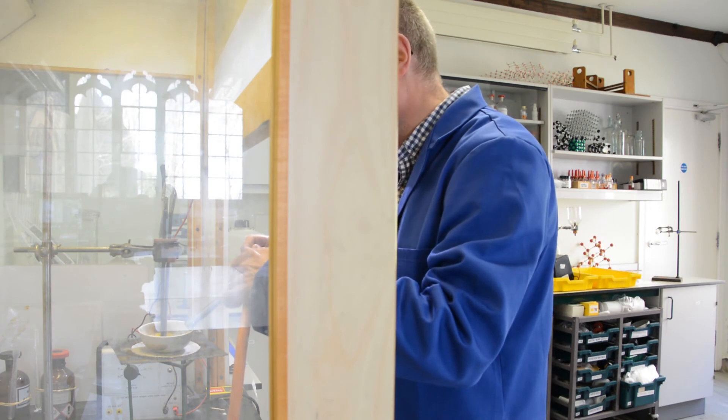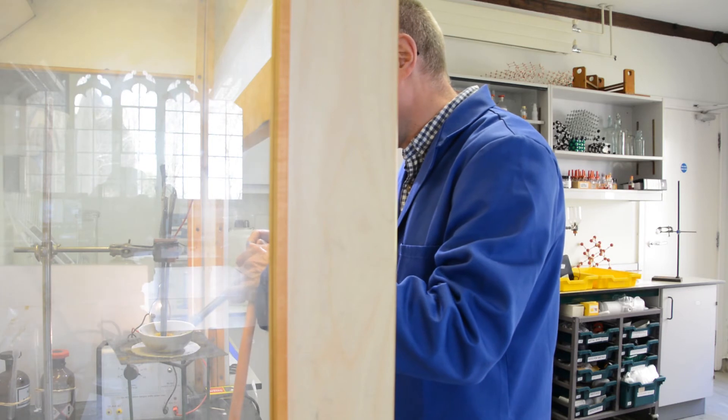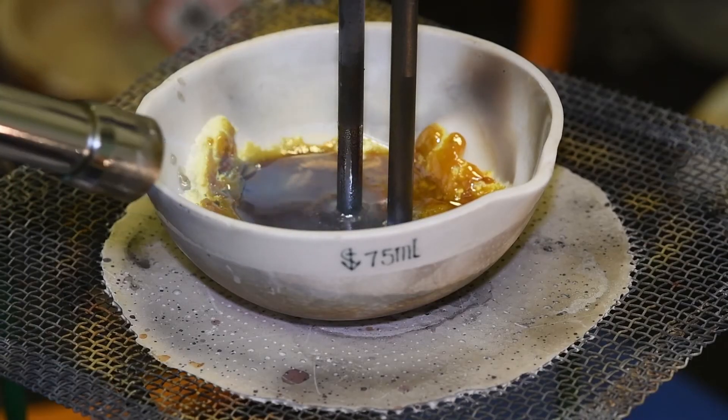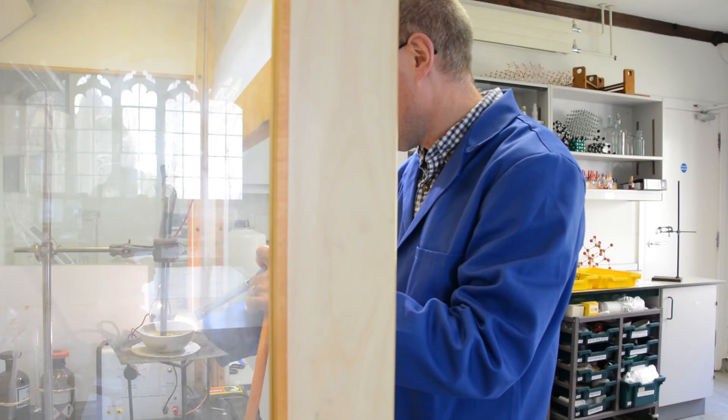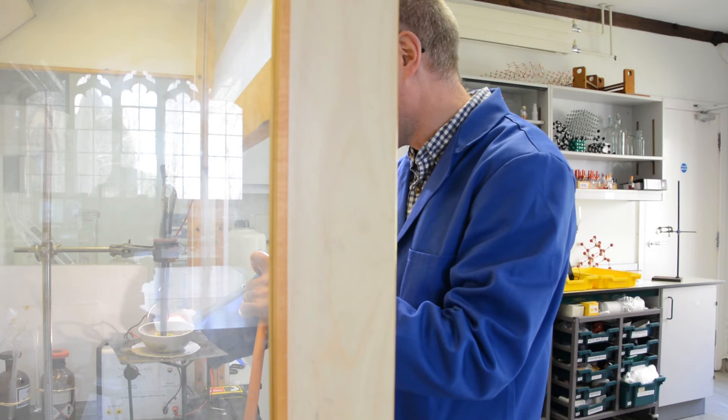Melting this a little bit more efficiently, there we go. So hopefully now you can see the bulb has lit, so we've definitely got an electric current flowing in there now.